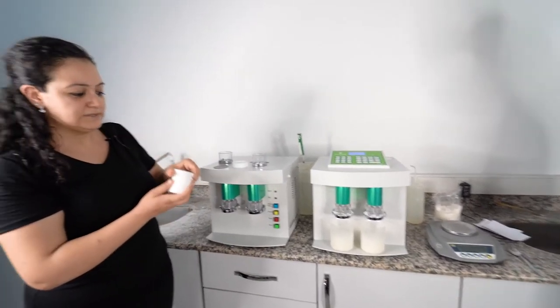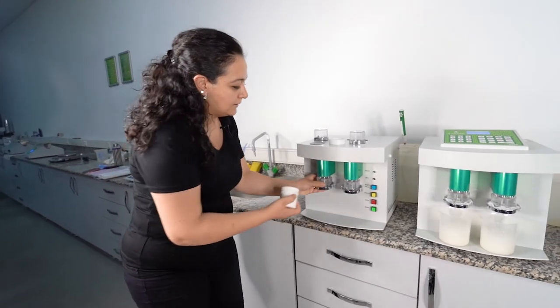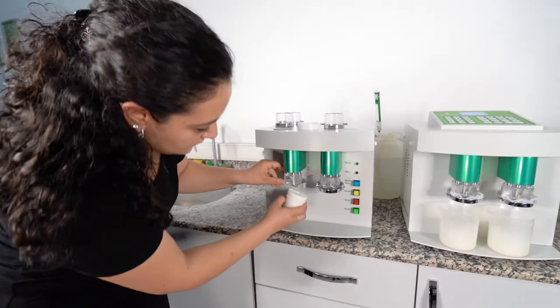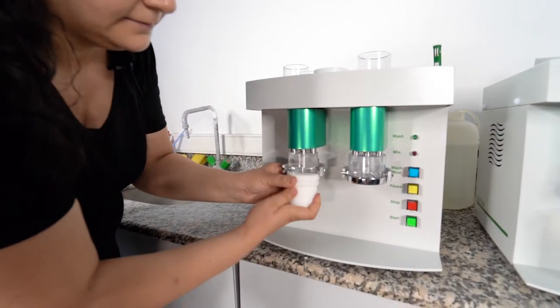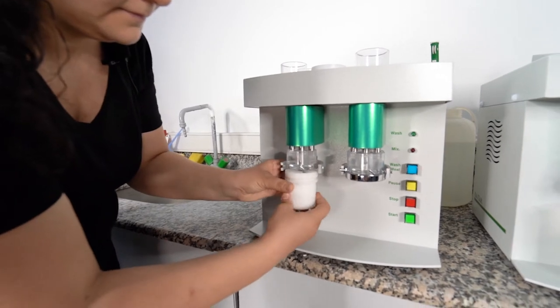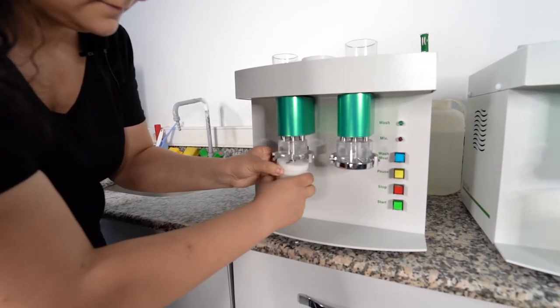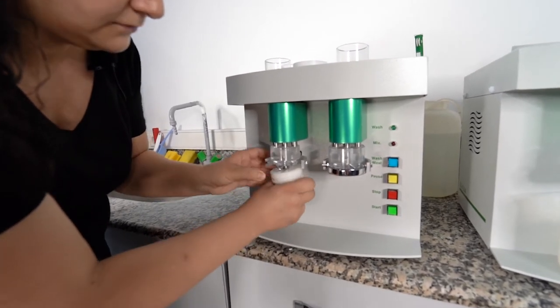For the cleaning process, you can use this one. It is a blade opener. If you wish to wash this one, you can open your blades. It's not necessary every time to take out this one.